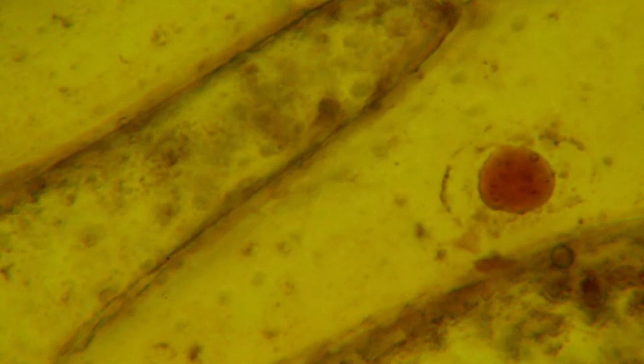Inside the nucleus, you can see nucleoli. They are fairly good size and darker in color, and they make the ribosomes. In this nucleus, there are many nucleoli.